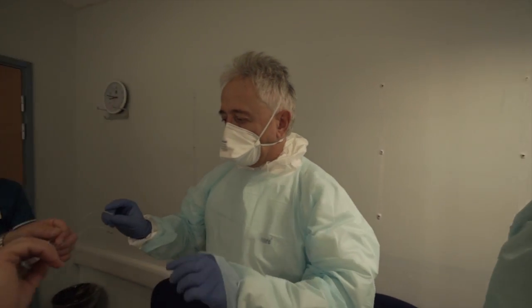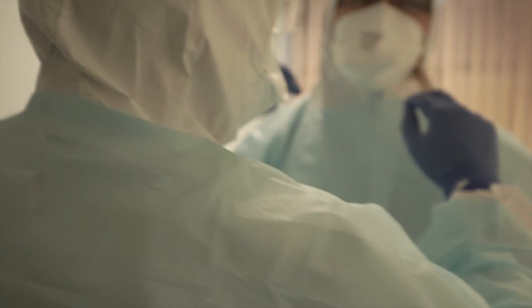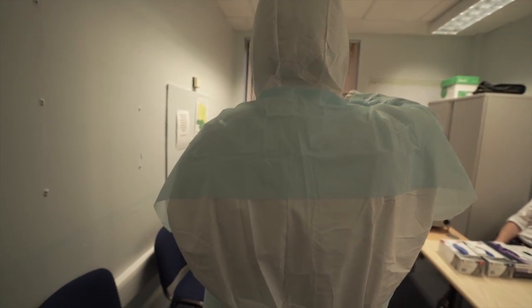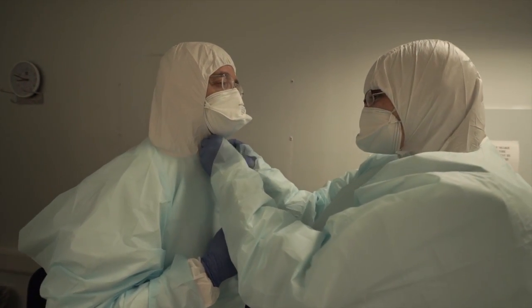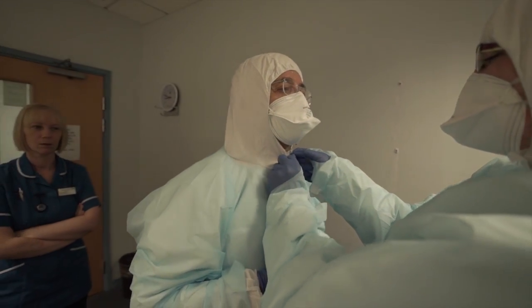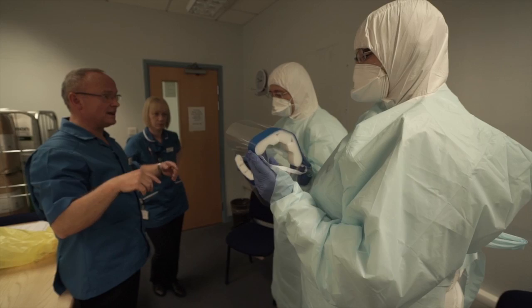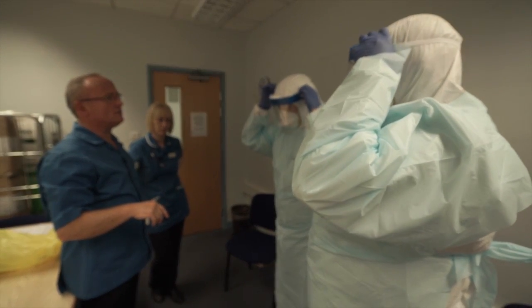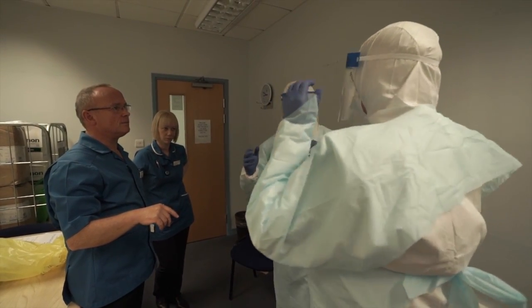So you'd like your glasses back — can you see that? The next thing is to actually put the hood on. This is where you get an itchy nose. The issue here is not so much having the kit on, which you'll find most uncomfortable. Just want to ease it slightly. Then you need to check each other again, because we do not want any skin showing above the top of the visor.